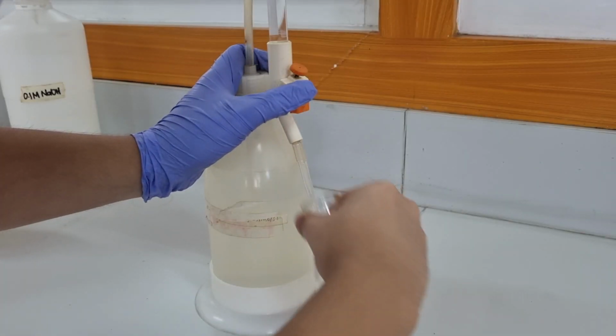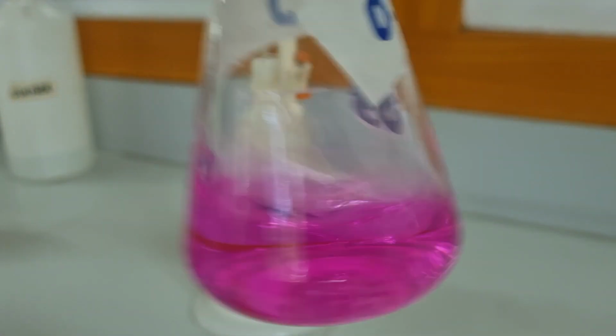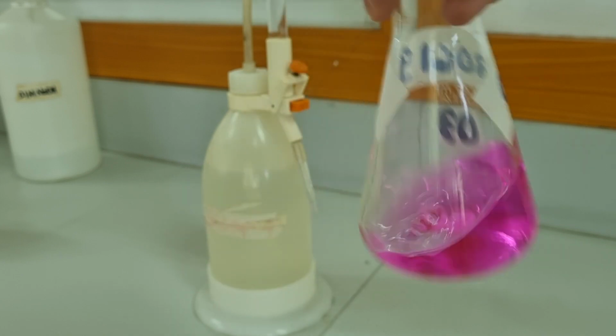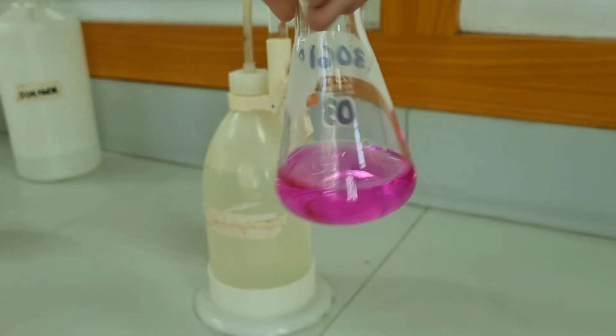To show you what it would look like if I over-titrated, I'm adding one more drop. Notice that the color is really dark, so at this point it's probably already beyond the equivalence point. Well, that wasn't that hard compared to gravimetry, but it's still pretty hard. Since it's difficult to control the droplets of the titrant or the sodium hydroxide, I had to be very careful to make sure that I didn't over-titrate. If I over-titrated, that is already classified as a gross error, and I would need to reject that titration and start over.